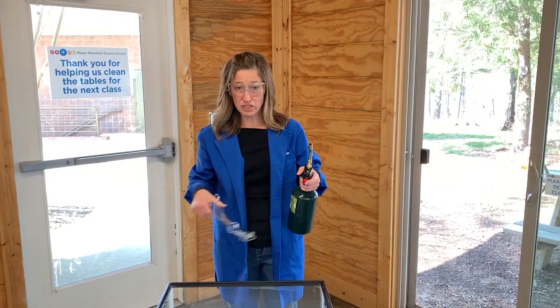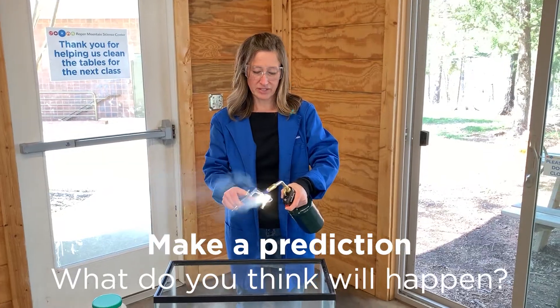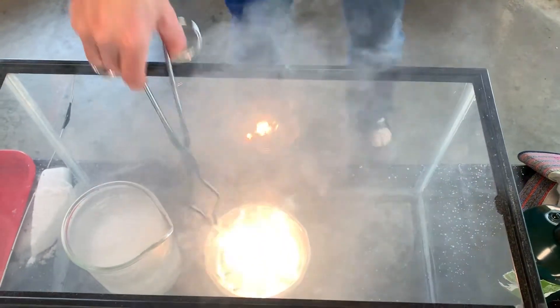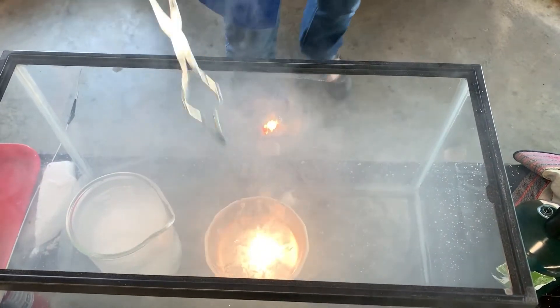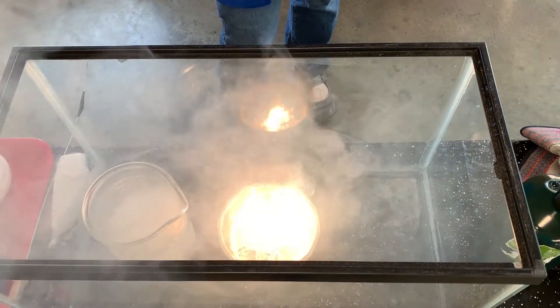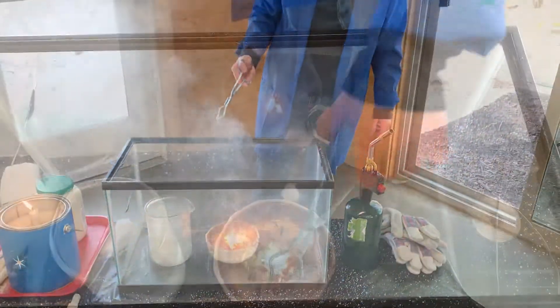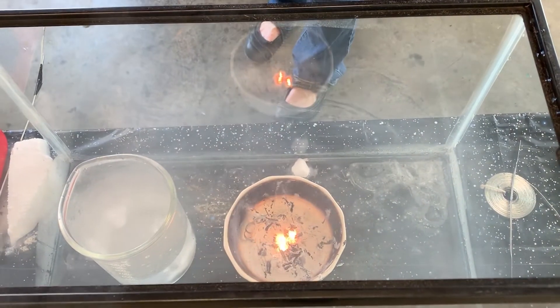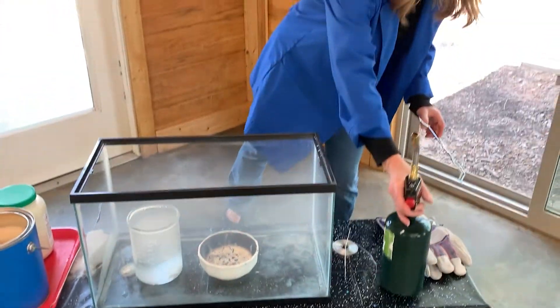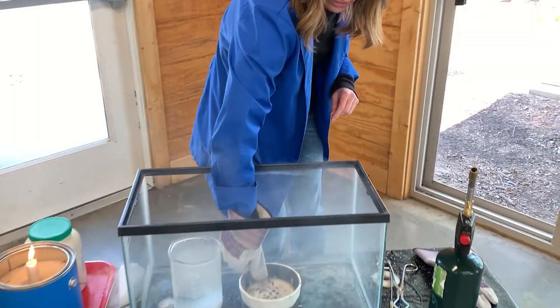When I put it in the carbon dioxide tank, it should go out — make a prediction about what will happen. Alright, it's lighting. Notice how it's not stopping — it's continuing to burn, and it's even starting to burn brighter. You can see the gas coming off. That gas is magnesium oxide. It's still burning even though this tank is full of carbon dioxide. We're going to let all those reactants finish their reaction, and then I'm going to reach in and take a closer look.